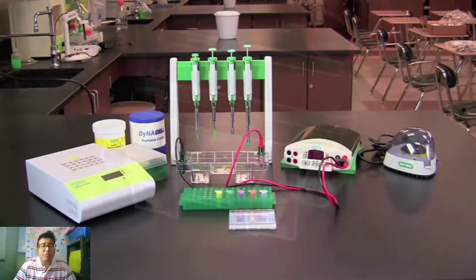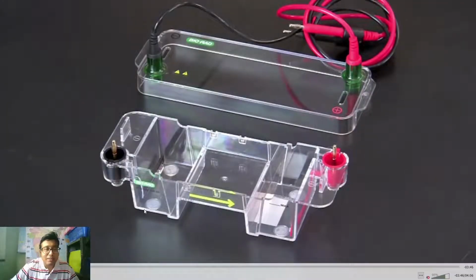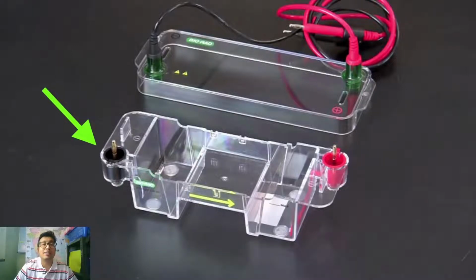So, we will move on, and this is the electrophoresis tank, okay. Over here you can see, we place the buffer on both sides, see this is the negative electrode and this is the positive electrode. There are wires and the red color is positive and black color is negative. Mind it, sample will always move from black to red, okay, because black is negatively charged and our DNA or protein will also be negatively charged.